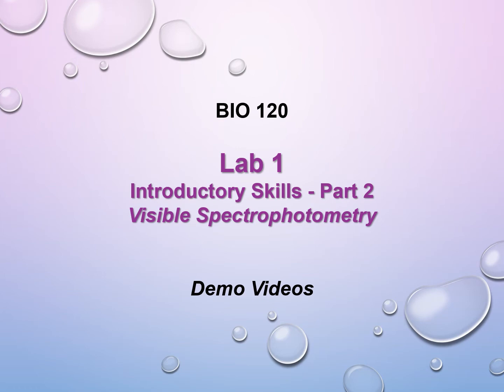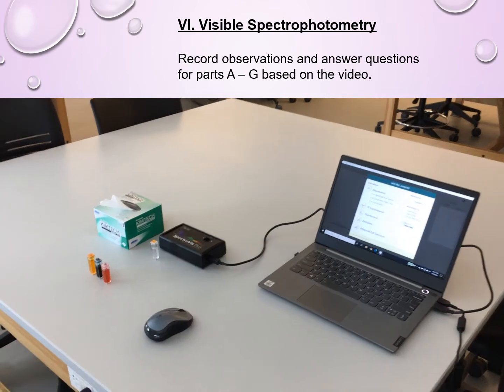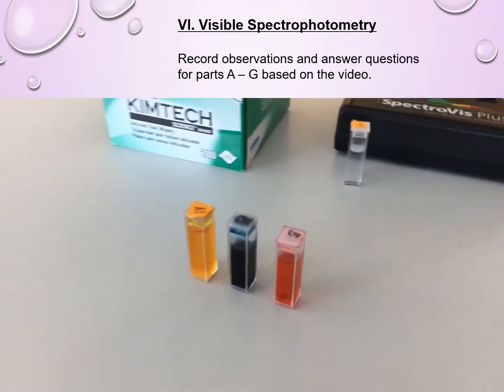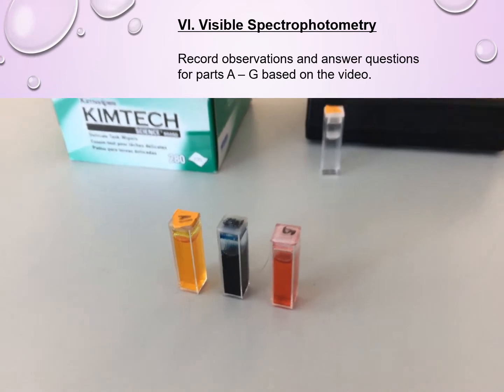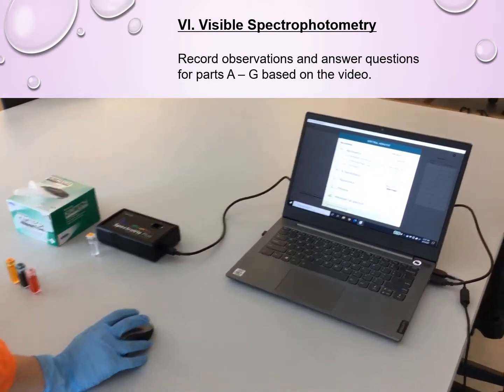In this presentation, Emily and Erin will demonstrate how to use a spectrophotometer to measure absorbance of various samples. In the first exercise, you first need to record observations of the 3 different color cuvettes. Pay special attention to the color of the cuvettes when you're doing it.